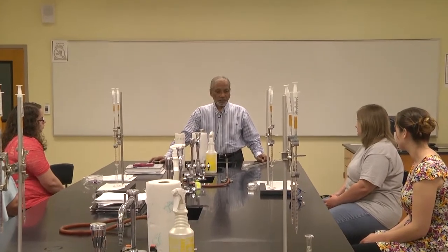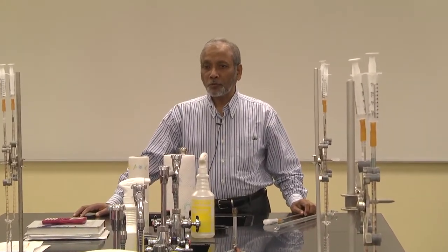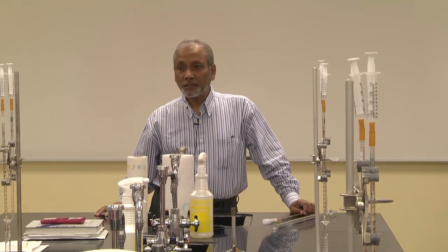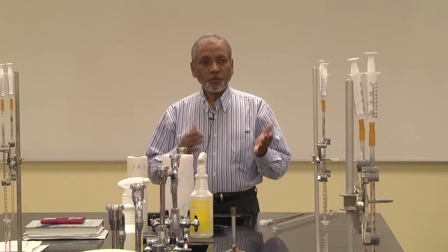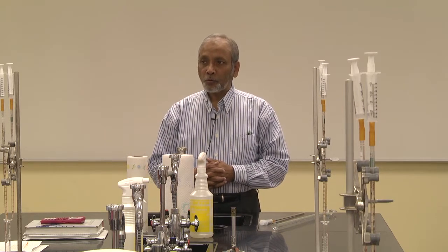Also, you have learned in the class the calculation of the concentration of a solution, right? You learned how to calculate molality and percent by mass. So what you will do in this experiment is calculate the molarity, the concentration of acetic acid in vinegar. Once you calculate the molarity, another thing you learned in class is how to convert from one unit to another unit. That means if you know molarity, can you convert it to percent by mass or molality? And that is something also you will do in this experiment.